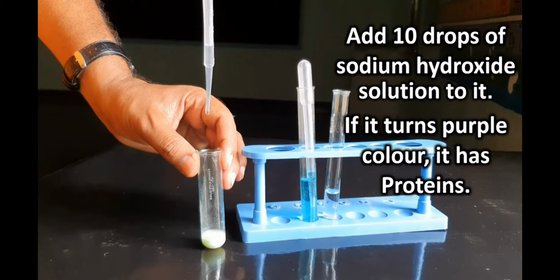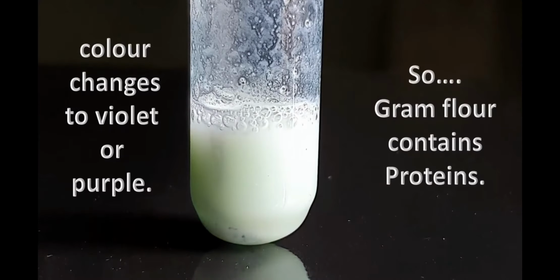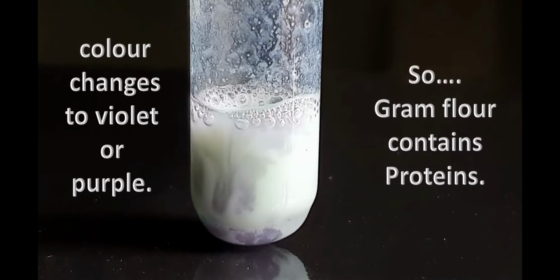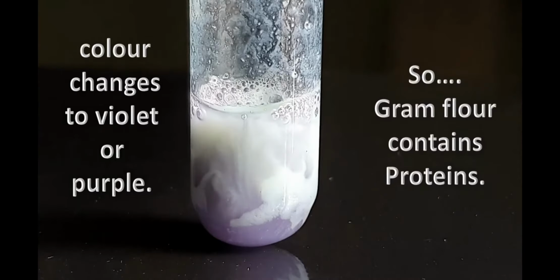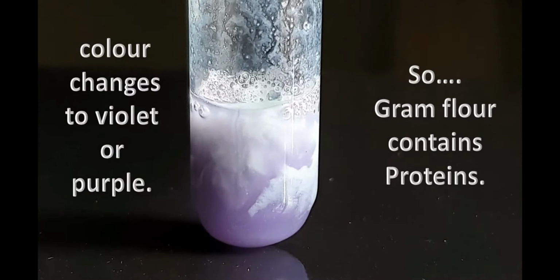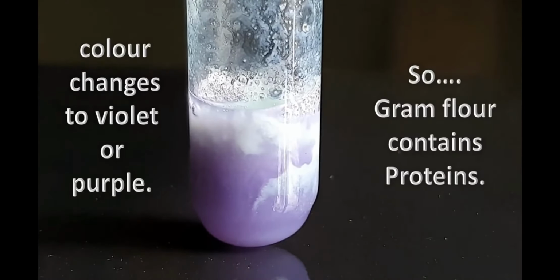If the red gram flour turns purple, then it indicates the presence of protein, right? You can see that it is changing into purple, so it indicates the presence of protein in the gram flour.